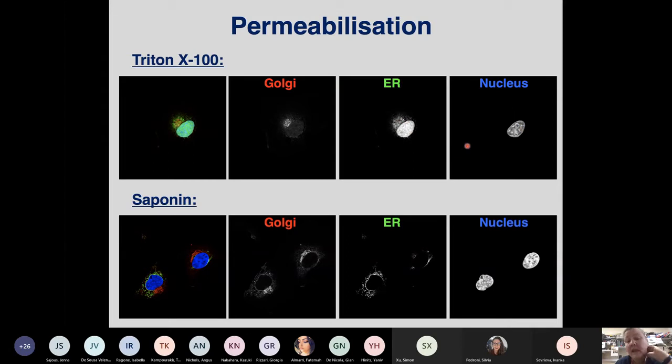And what I'm massively concerned about is that I have all this signal in the nucleus, which I have counterstained with DAPI. And if I use exactly the same cells, exactly the same fixation, and the only difference is which detergent I use, suddenly with the Golgi, we see these textbook-like stacks of Golgi apparatus. And this is relatively comparable. But with the endoplasmic reticulum, the picture has completely changed, because here we see something which again looks like textbook endoplasmic reticulum, and all this nuclear stuff has gone. And the only difference was the detergent. So be careful if you're looking at membranous organelles. Saponin is your friend. Also, if you're looking at autophagy, autophagosomes, and so on and so forth, Triton is not your friend.